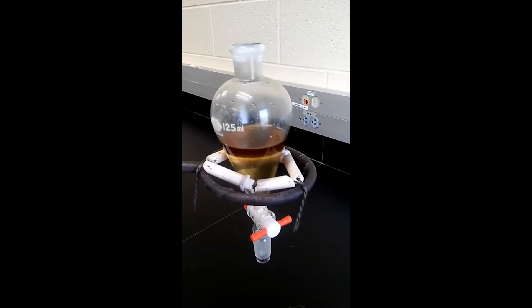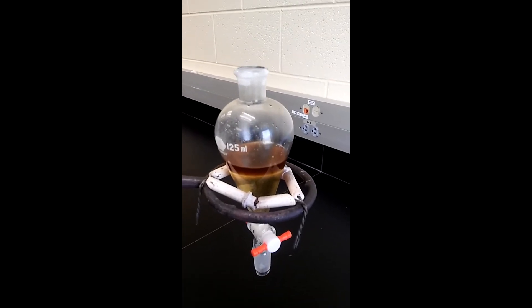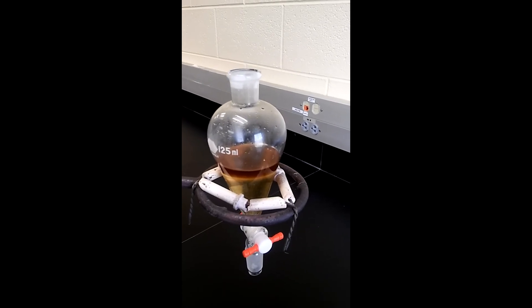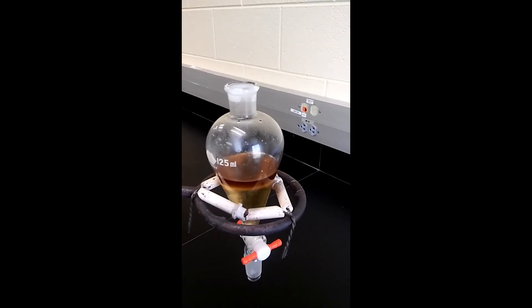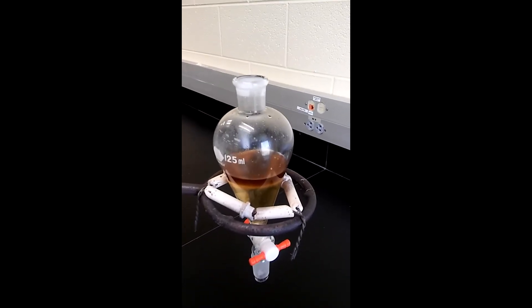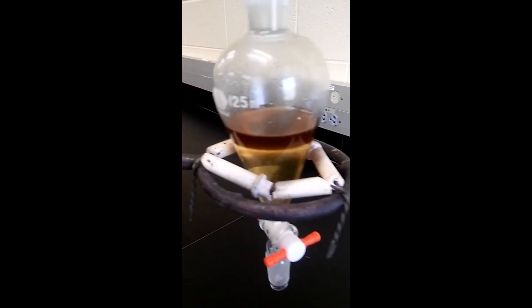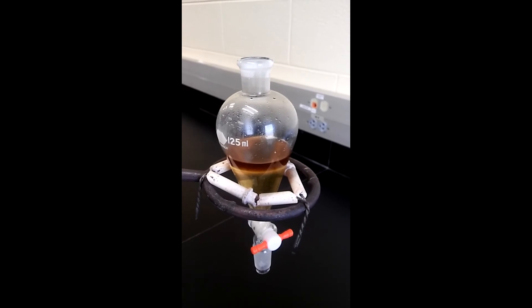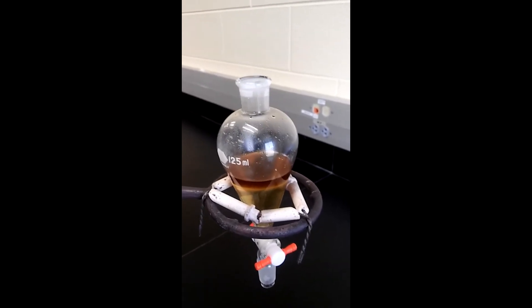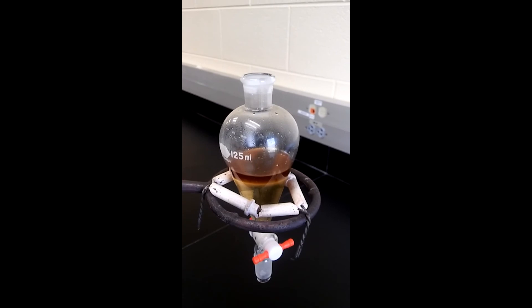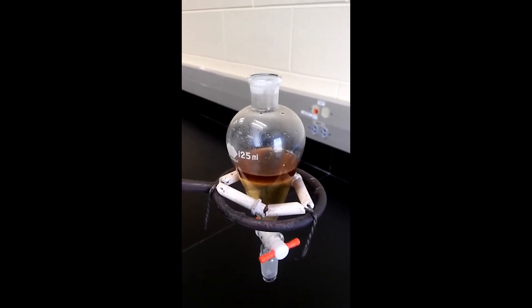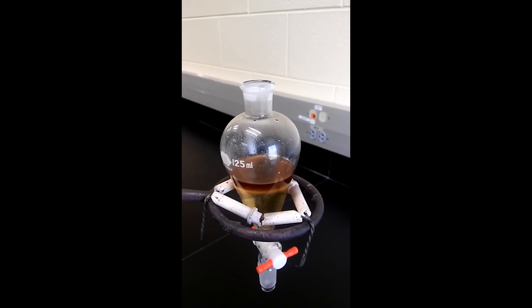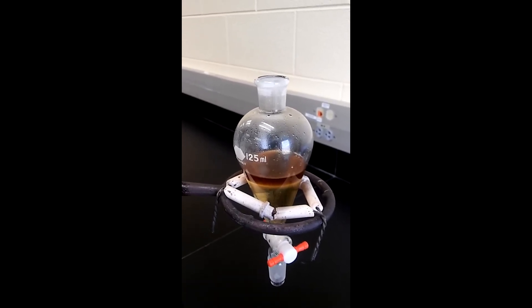You can already see the layers are separated and I haven't even shaken the mixture yet. But again, keep in mind we've added water and there was organic stuff in the funnel, so you would expect a layer separation. I'm gonna shake it and then move on to the next step in the extraction process. When I come back, I'll show you what happened with the current step and what would be my next step in the extraction process. Stay tuned.